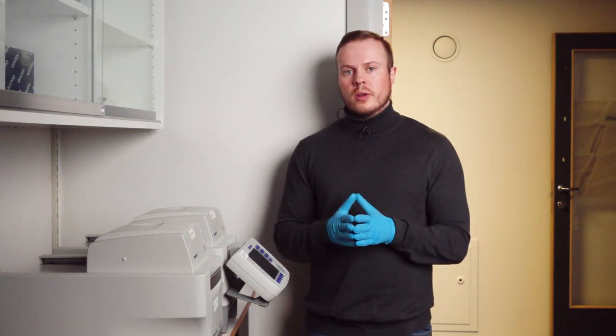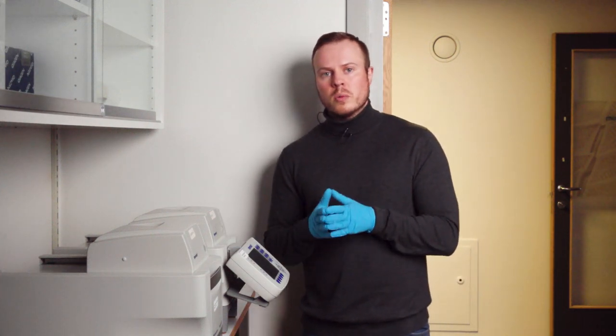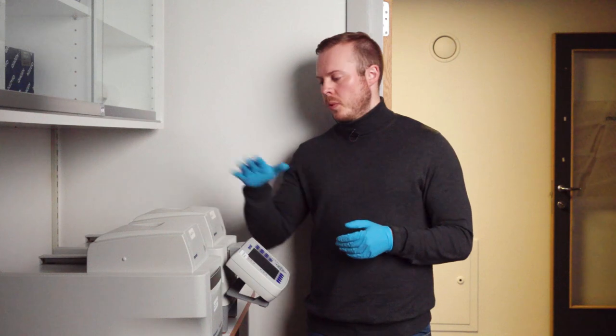When this is running I strongly recommend starting with the gels so it's prepared when the samples are ready here. It makes a better working flow and saves a lot of time.